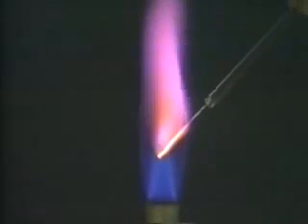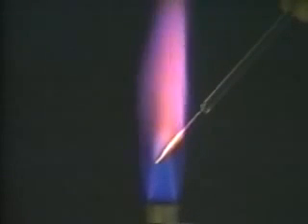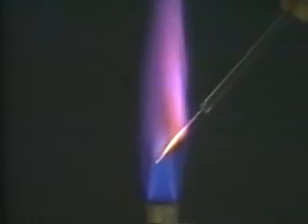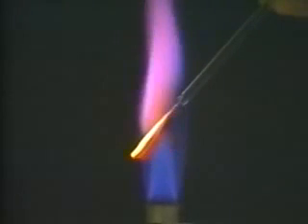All these colors arise because the alkali metal atoms are raised to excited states by the temperature of the flame and then return to the ground state, emitting light of a characteristic frequency.